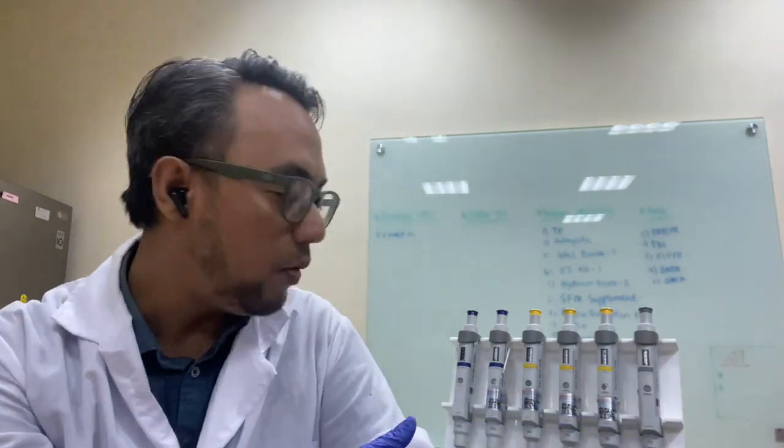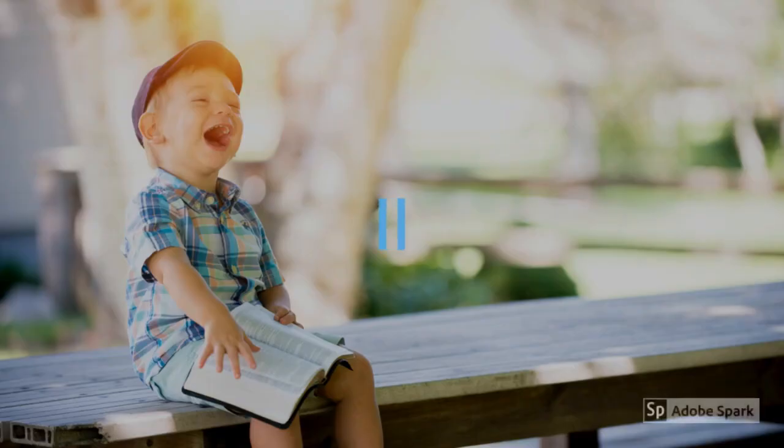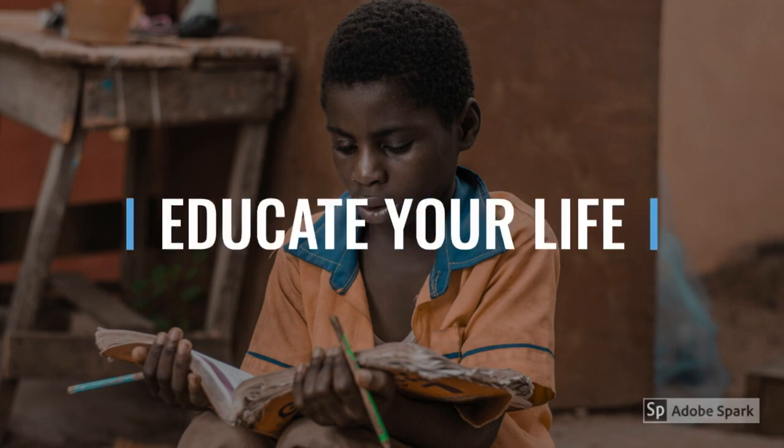The pipette is ranging from 1,000 microliter to 10 microliter. So, check this video. You only live once. Educate your life.